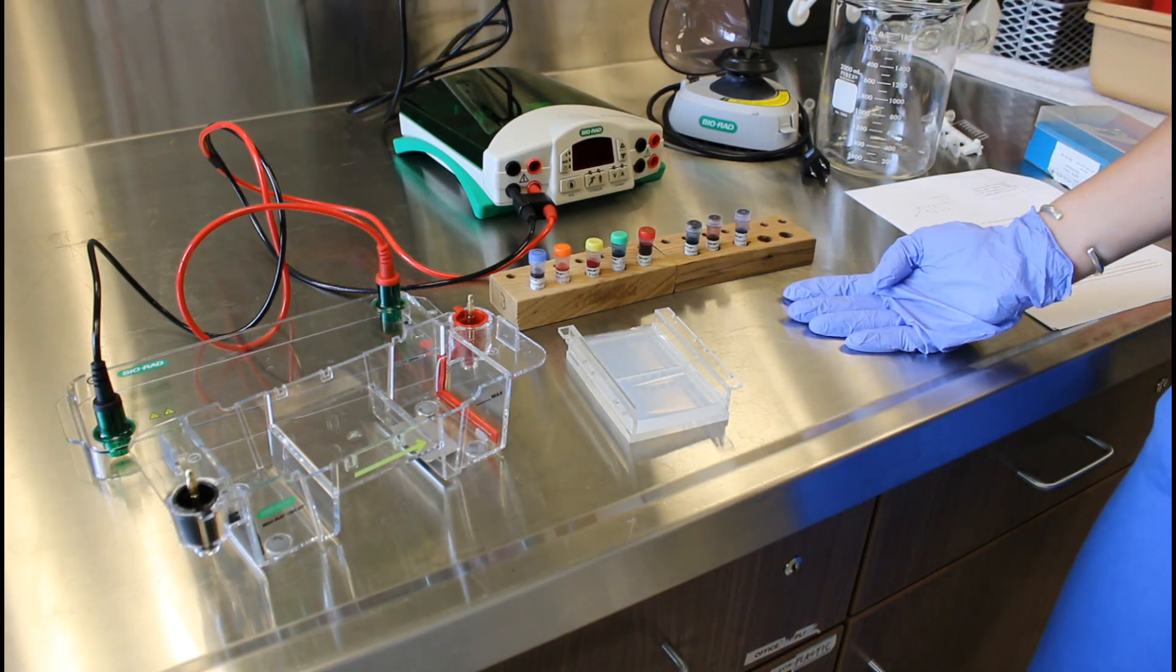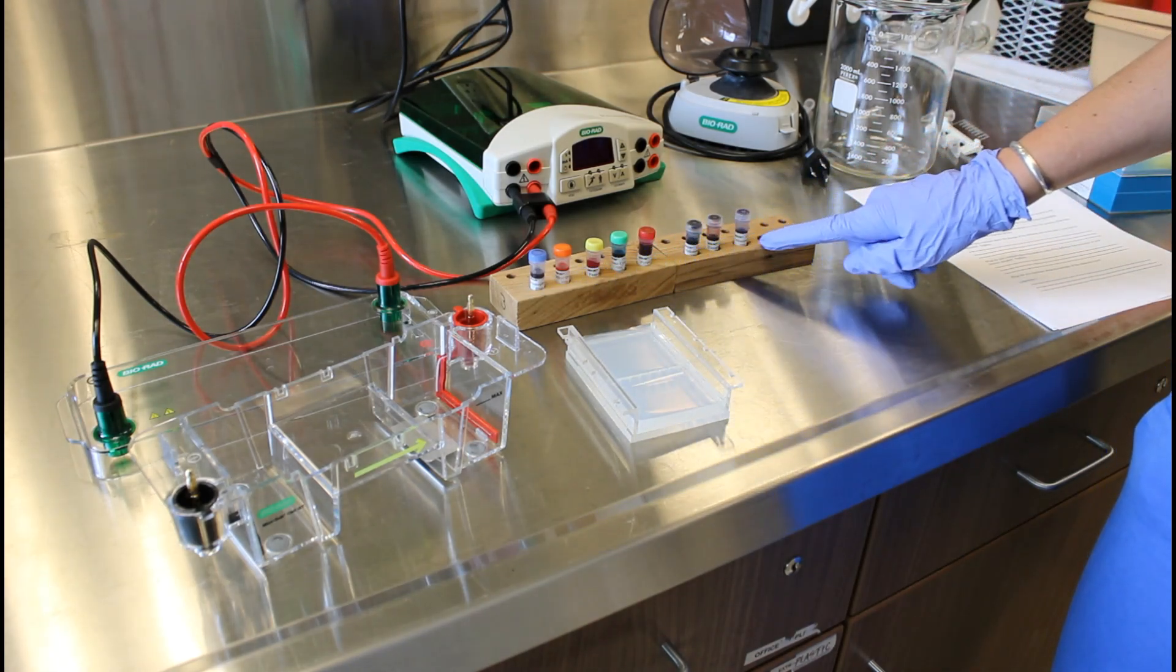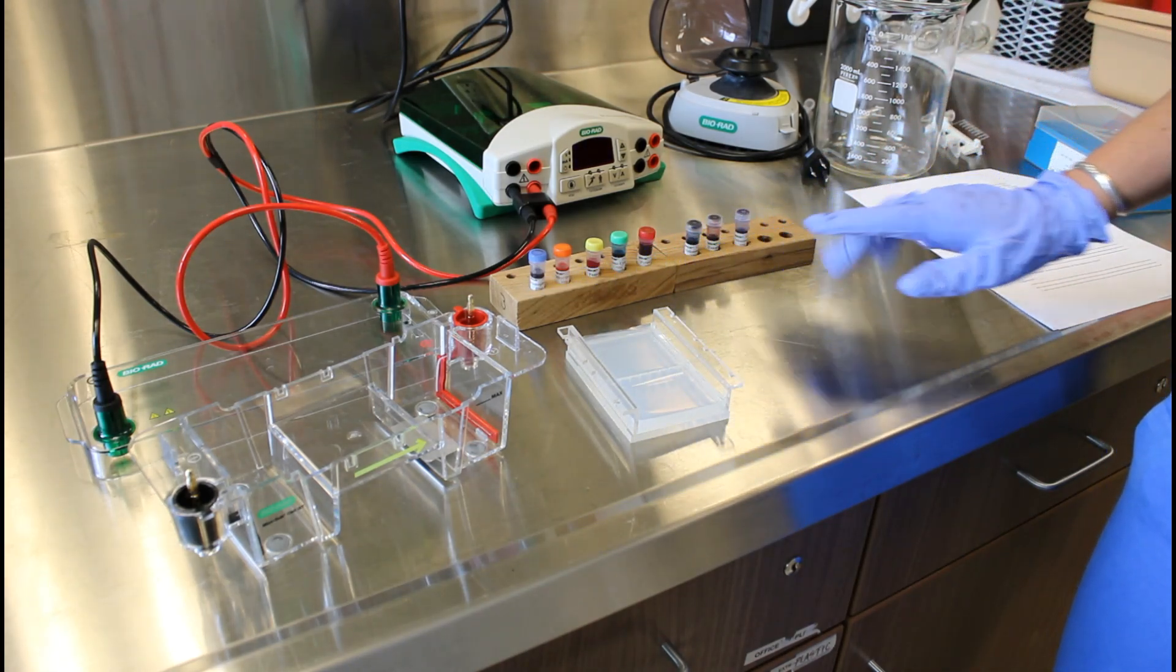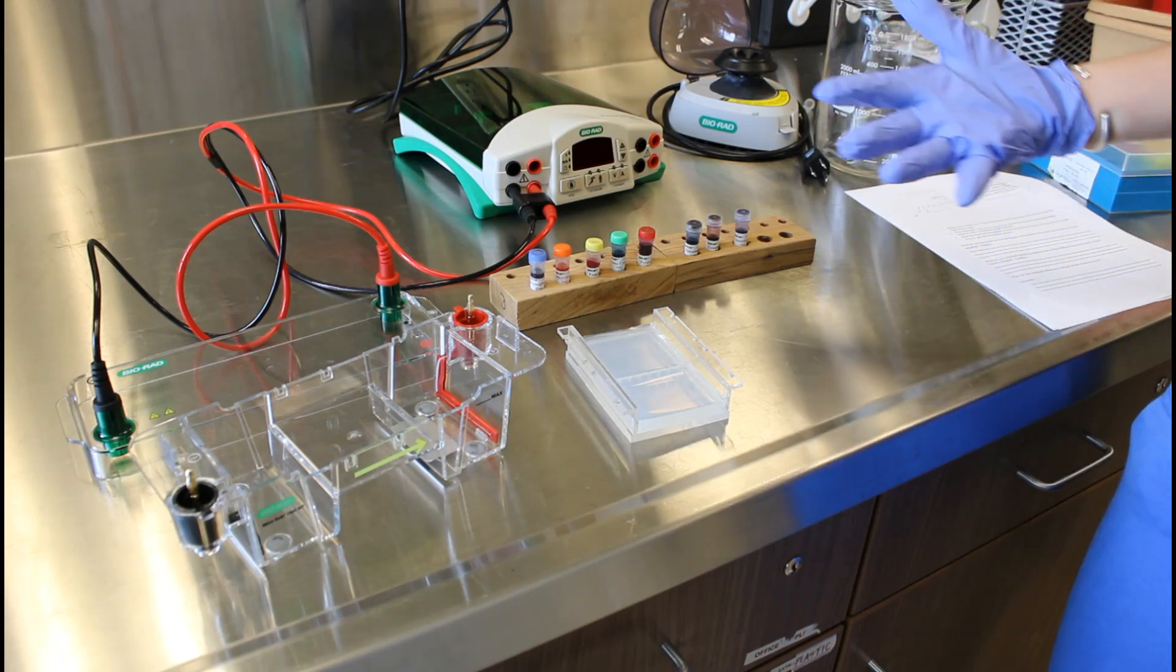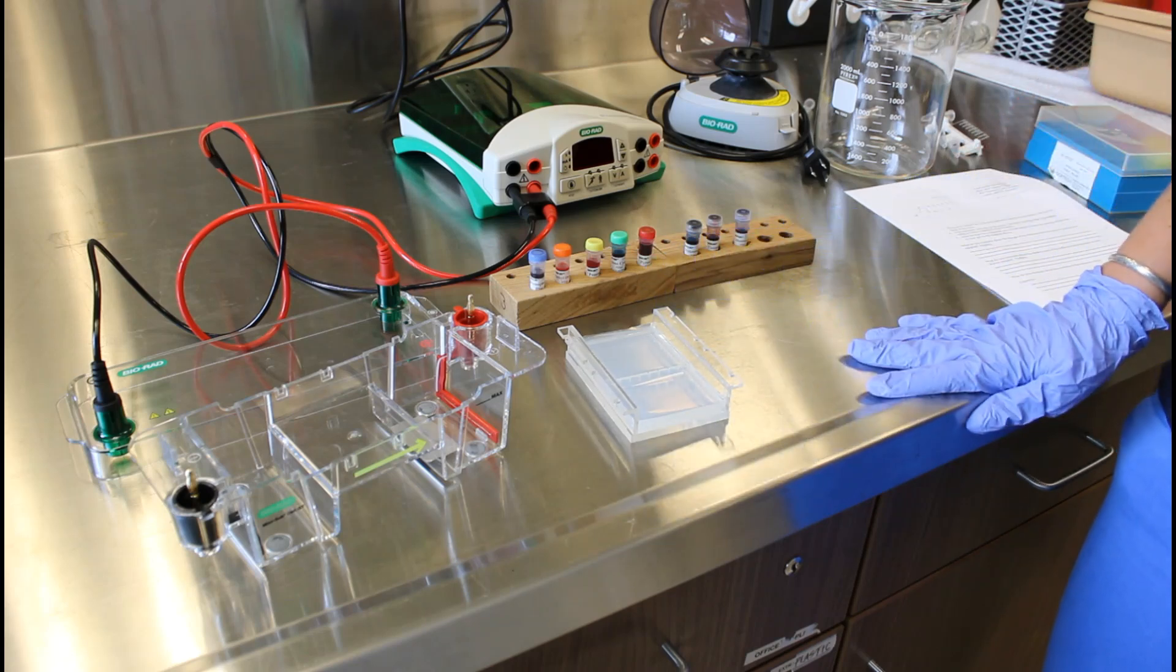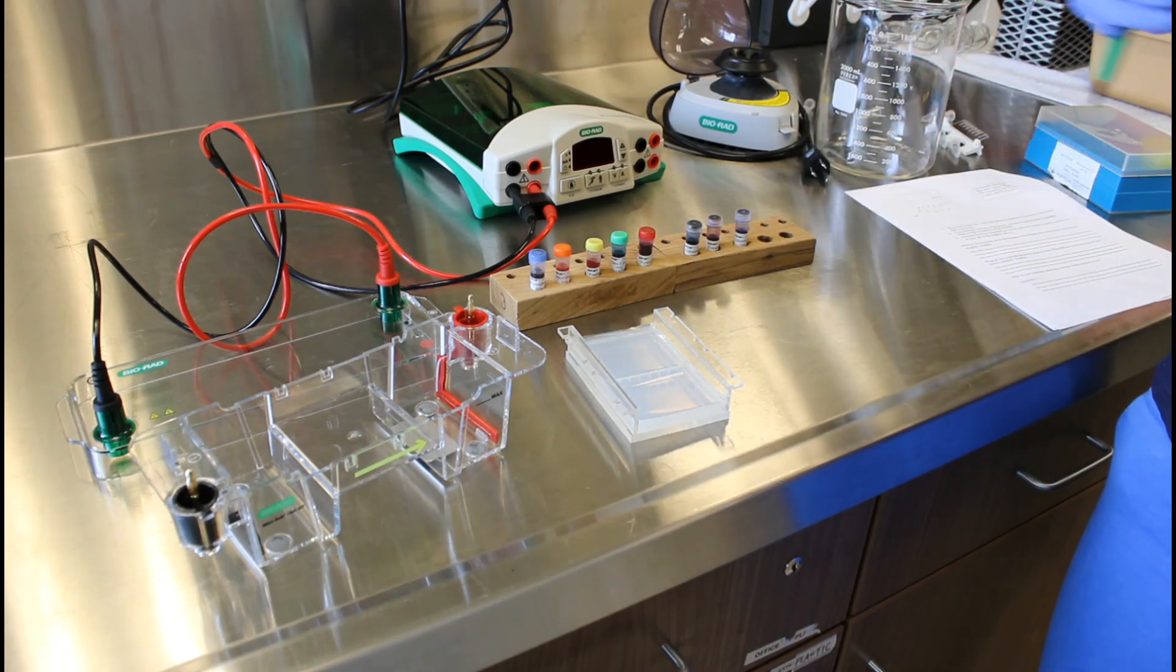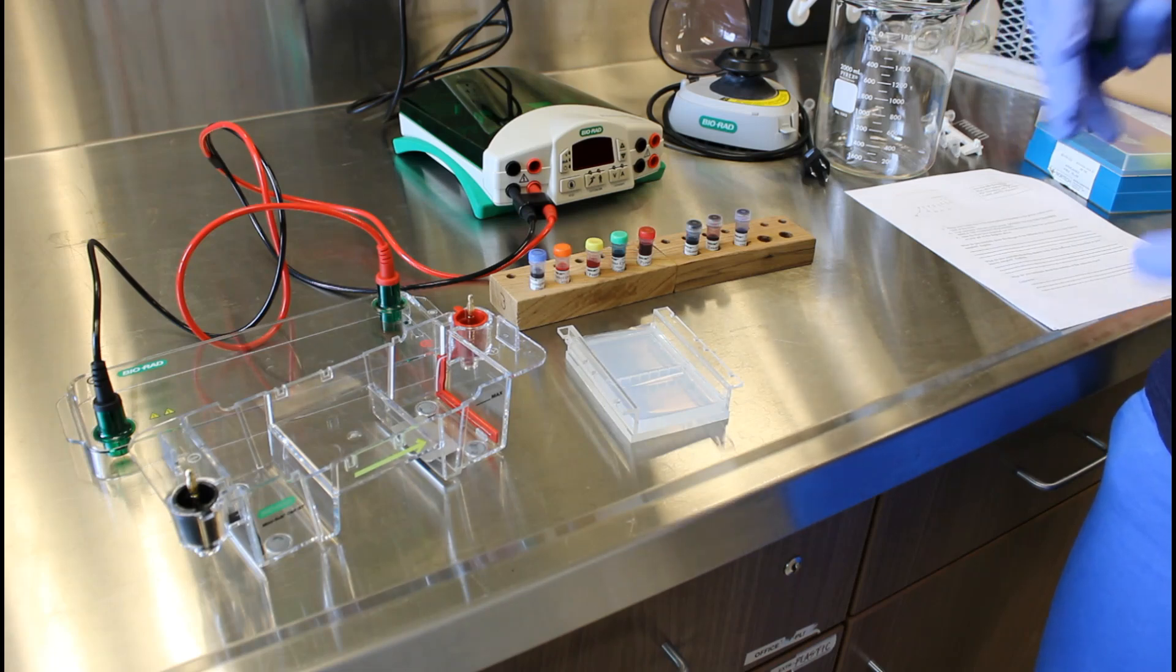In this demonstration we're going to use it to separate out these dye molecules by their size. It's also useful because you can compare the results of gel electrophoresis and you can start to try to determine the identity or the exact size of some of the molecules that you've run on your gel.